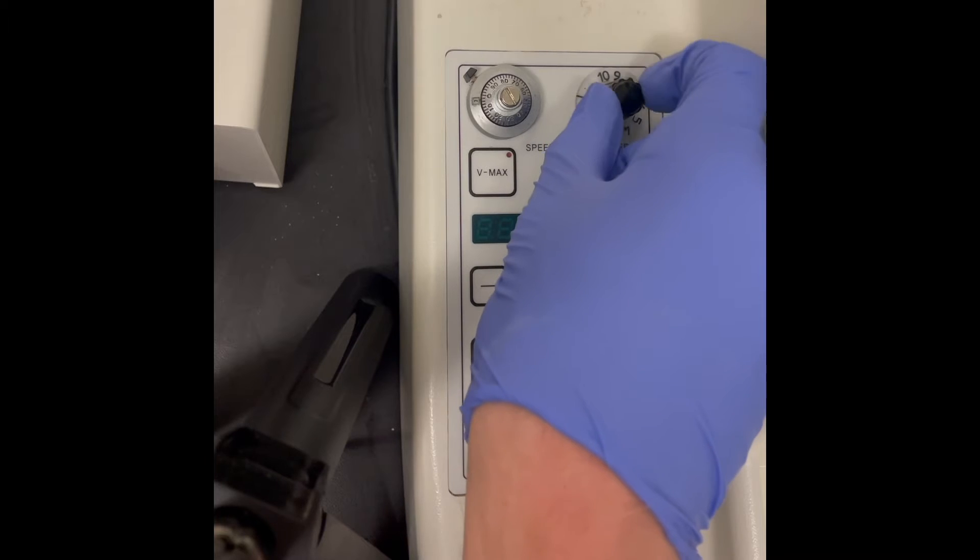This knob here controls the frequency of vibration of the blade. We keep this setting around 9.